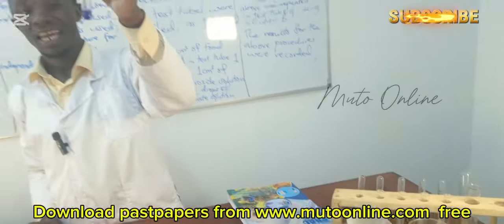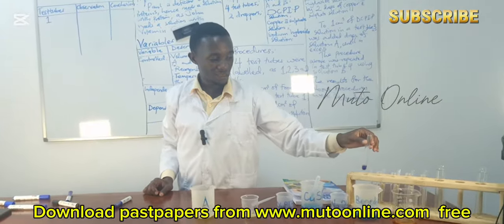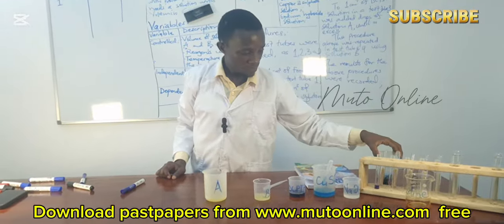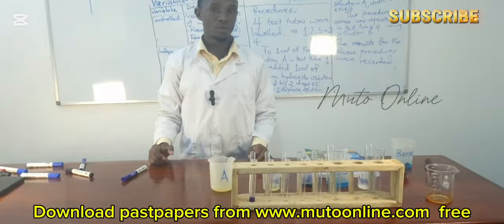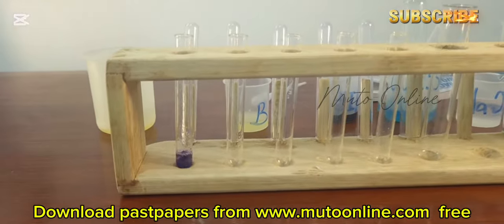Like for this one, which color is that? When you look at it, I think this is purple. I think in test tube 1, the solution is turning to purple. So this means you come and write your observation.